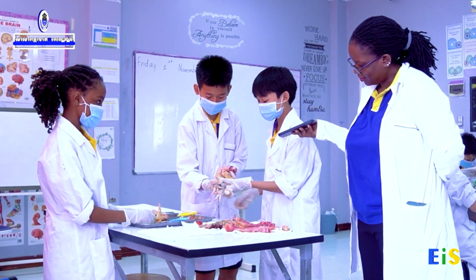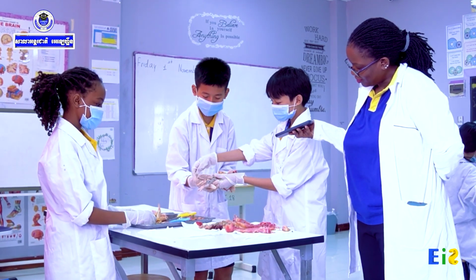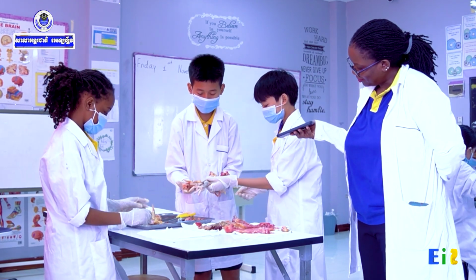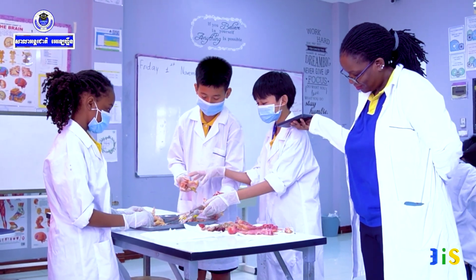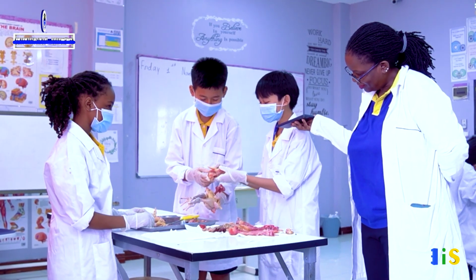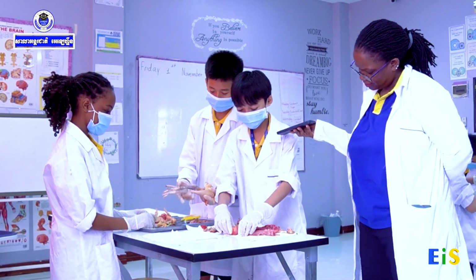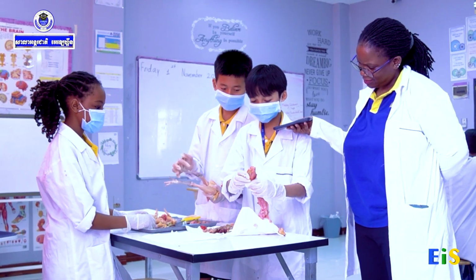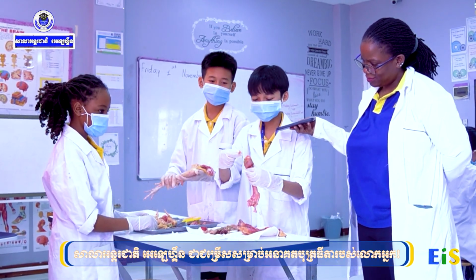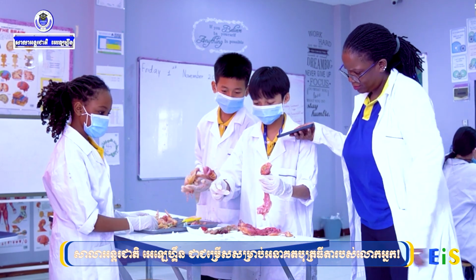So this is the chicken leg. There are sharp claws on it, which stabilize the chicken on the ground. These are chicken wings. And this is the head of the chicken, and these are the beaks, and the eyes are right here.